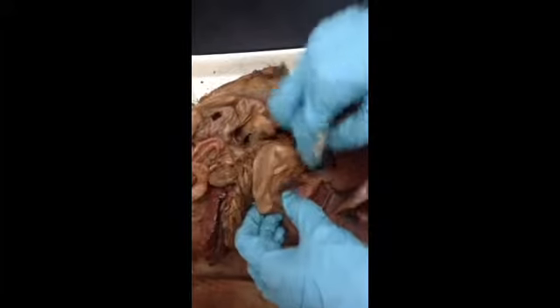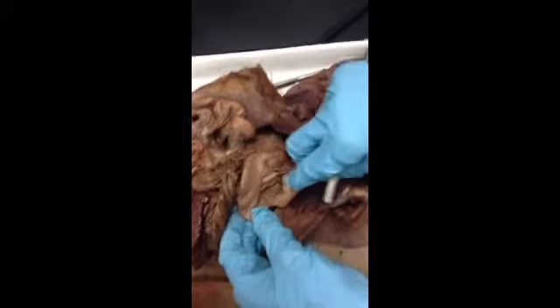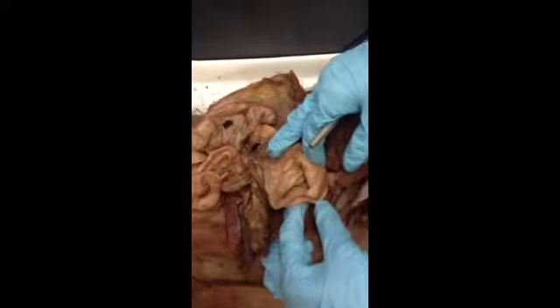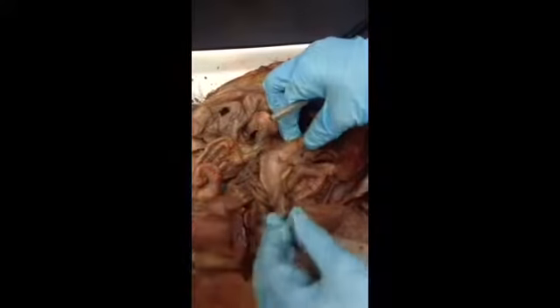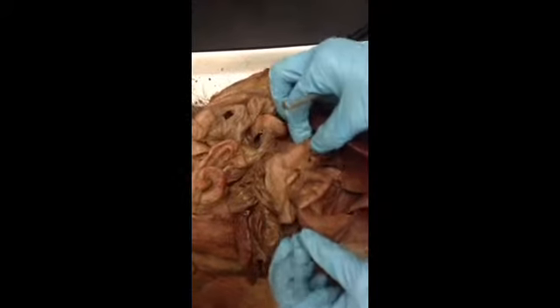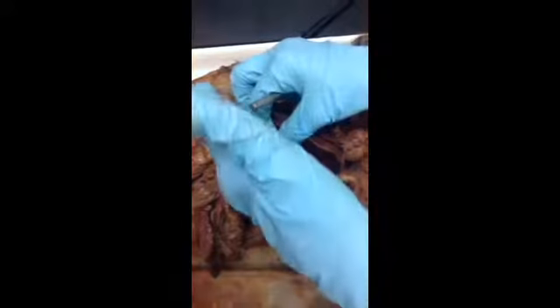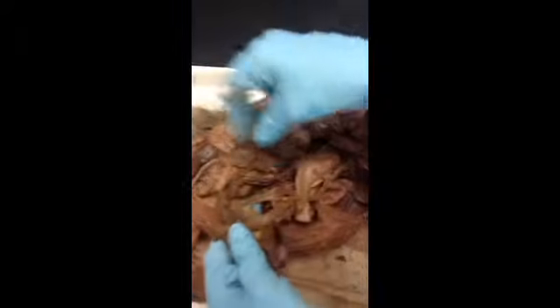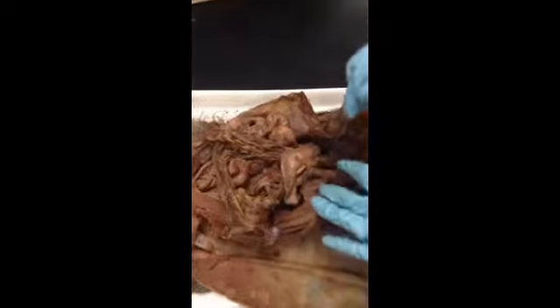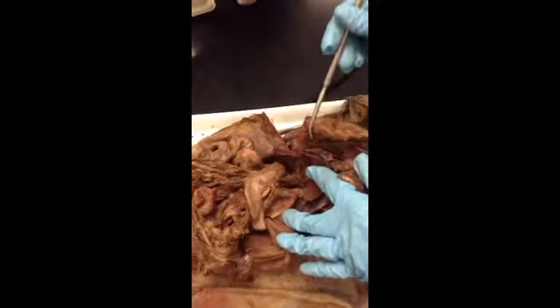And we have this J-shaped stomach right here. Okay, and we pull this back. We can see those extra folds of tissue in there. Those are the rugae, so that the stomach can expand. And at the end of the J, right here, we have another sphincter called the pyloric sphincter that regulates flow from the stomach into the duodenum. Okay? And all of this gooey stuff here, this is the greater omentum, that fatty apron attached to the greater curve of the stomach. This goo here, this is what's left of the lesser omentum, and that's attached to the smaller curve of the stomach.